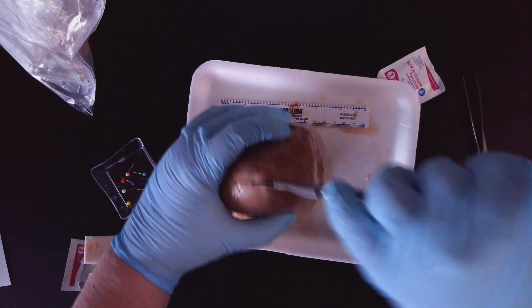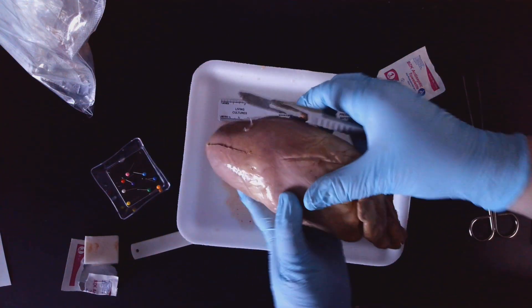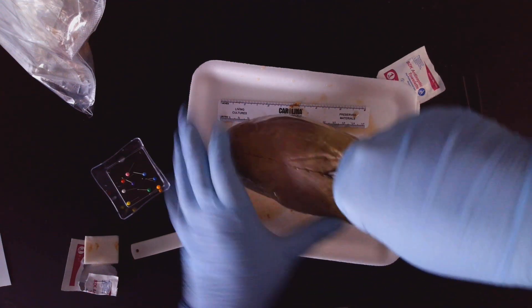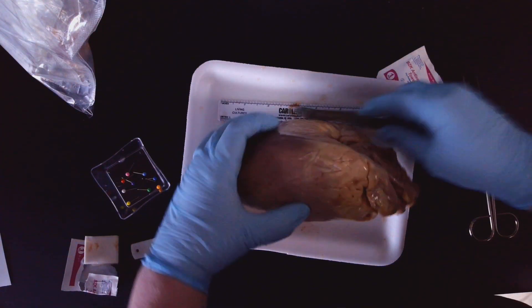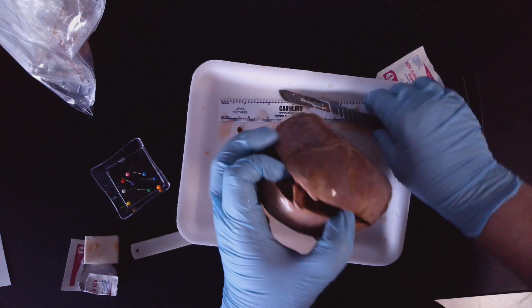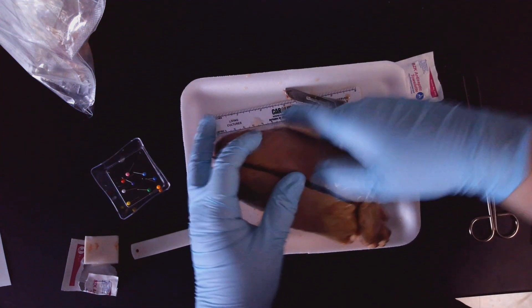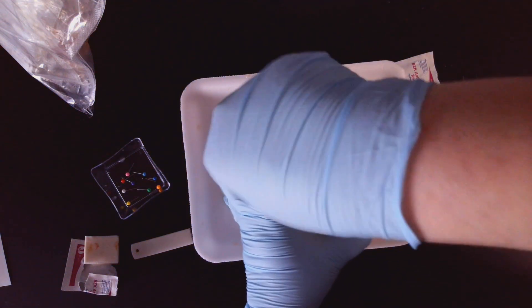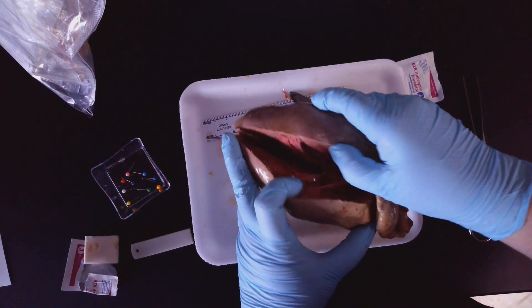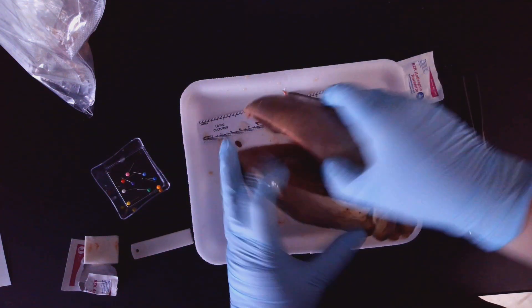Come around this way. Move slowly with that scalpel. Now that I've gotten over here, tilt it on its side — it's a little easier. Continue cutting like this. Now when I set the scalpel down, I want to try — so see that little part right there? Let's cut that. I still have some held right here, so I'm going to reach again down here with my scalpel. Set the scalpel down. I don't want to try to do both at the same time. Reach in again. Looks good.